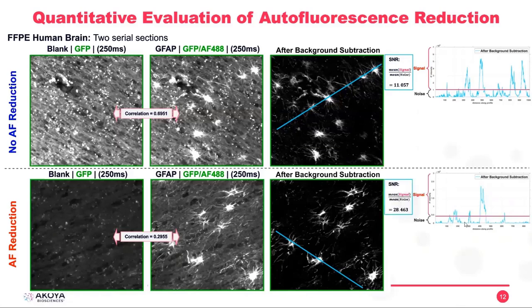And if you measure the signal to noise ratio, here it's 28 and here it's 11. So it's three times higher signal to noise ratio with autofluorescence reduction compared to without autofluorescence reduction.